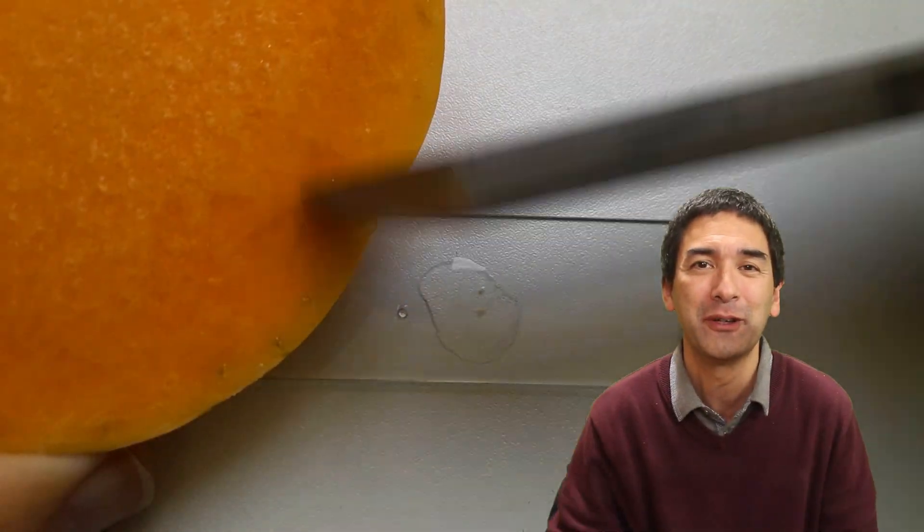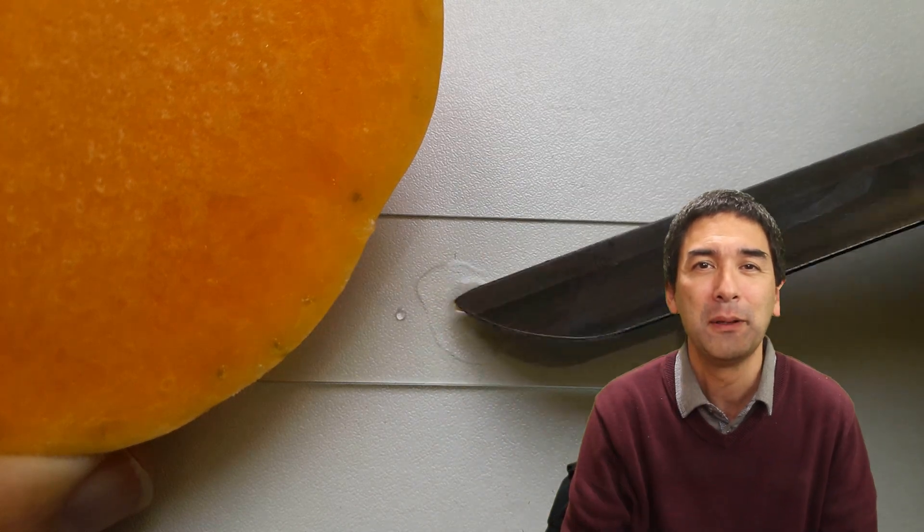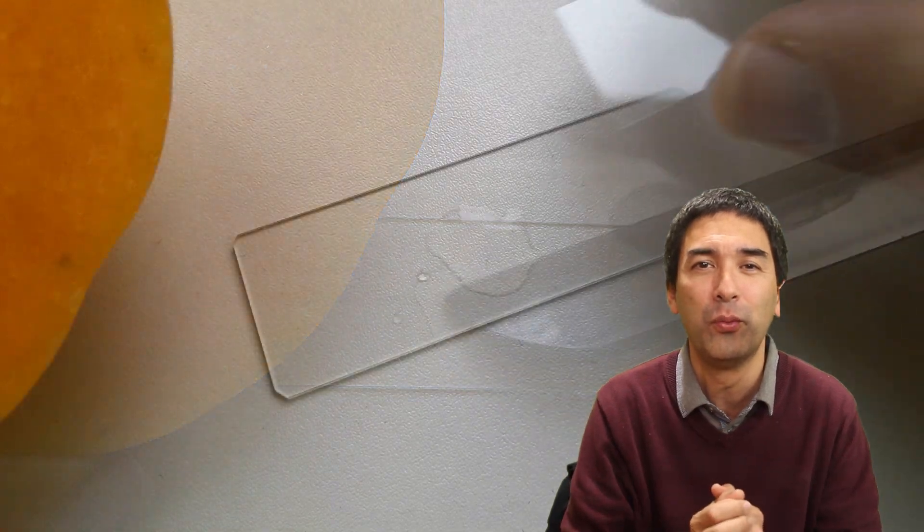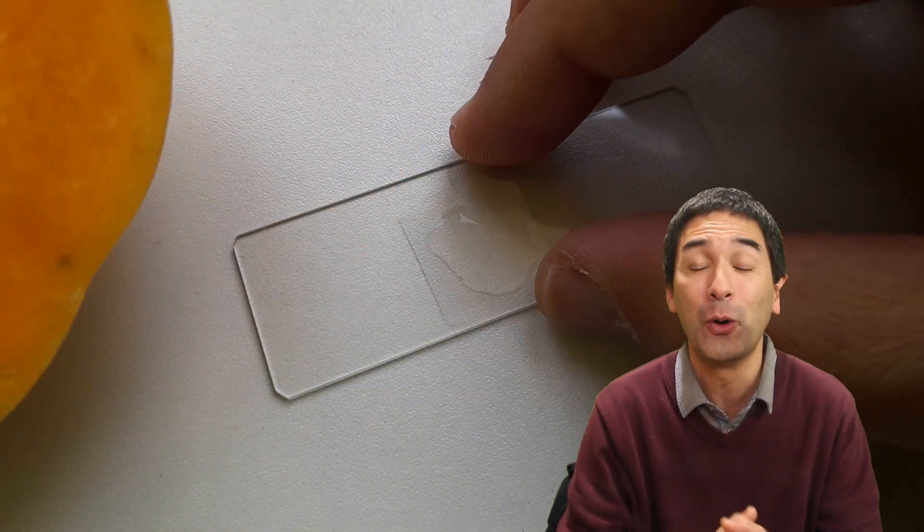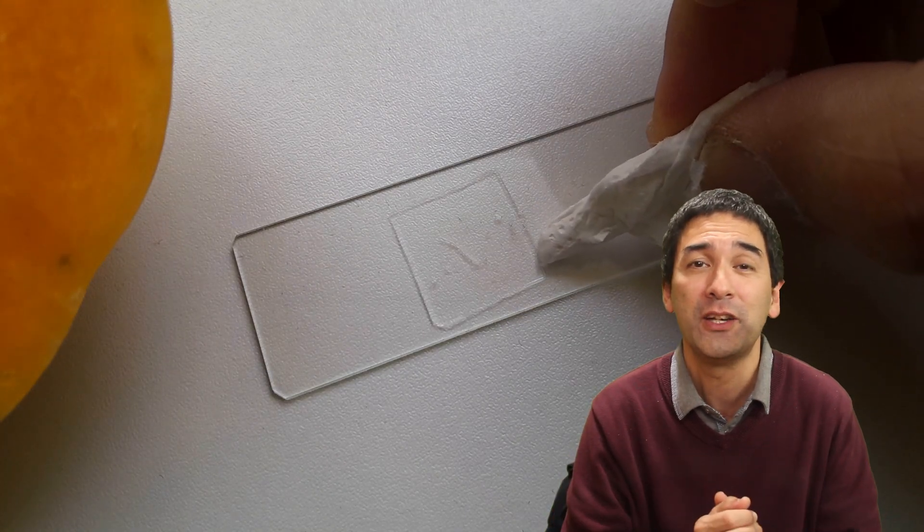I found out that I didn't have enough sample material, so I repeated this a little bit. You can see the pulp of the pumpkin on my knife tip. Something has been washed off into the drop of water here. A cover glass goes on top, and now under the microscope I'm able to find out why pumpkins are so energy-rich.